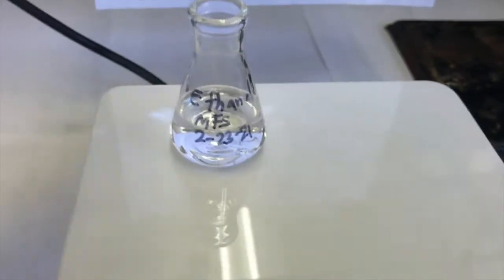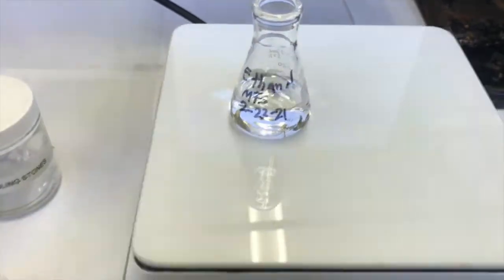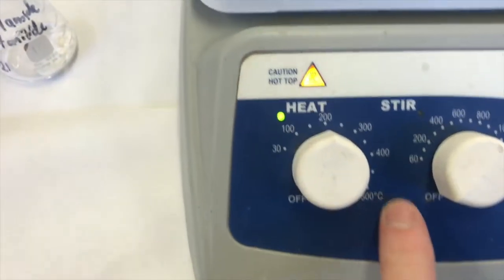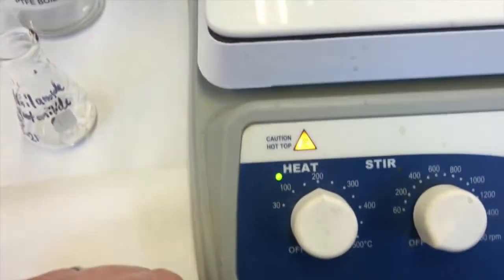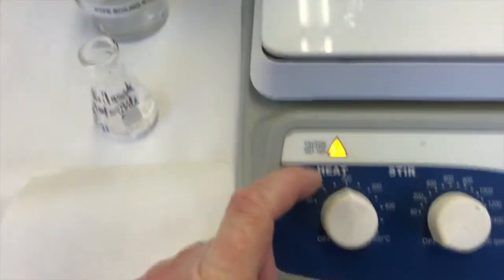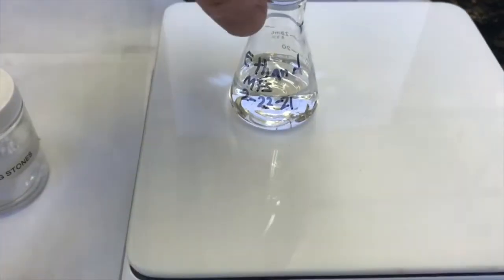I came back to check on my heating ethanol and it's not boiling yet. So I went ahead and I turned up the temperature to 200. I'm not sure how accurate the degrees Celsius is for these values. And even if I have it at 200, the hot plate's not at 200 right now. It might heat faster. I'm not 100% sure if it heats faster if I have it on 100 or 200 if it's below 100. But I'll just put it there and we'll wait for the ethanol to start boiling.